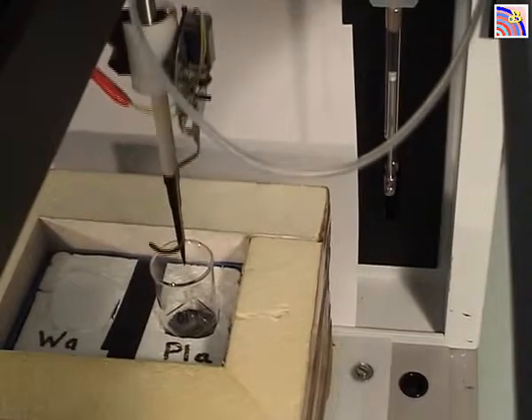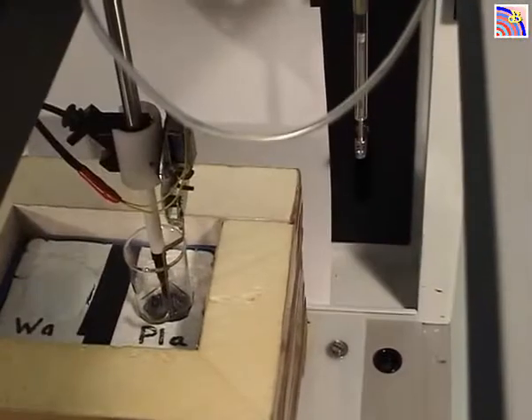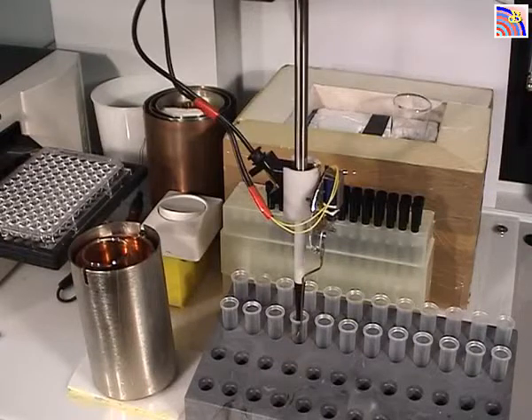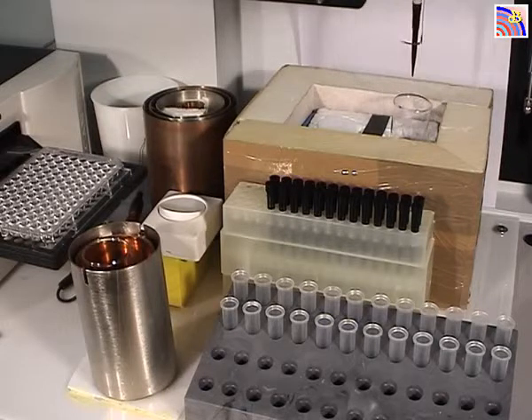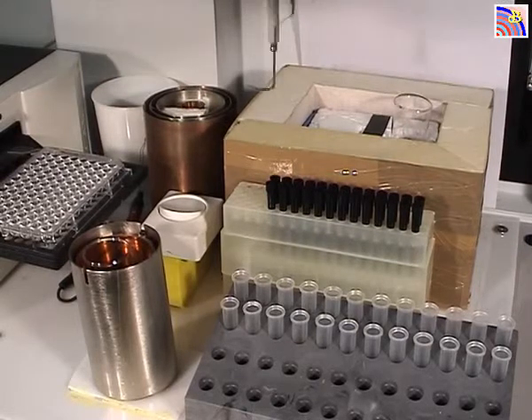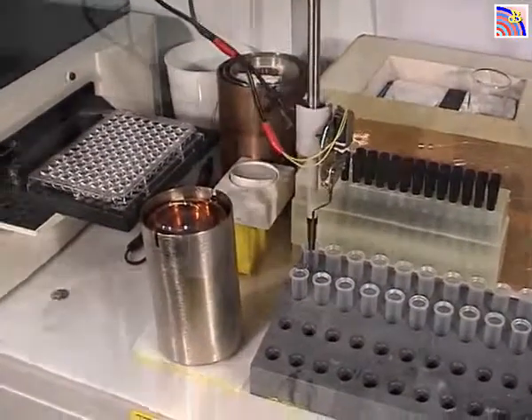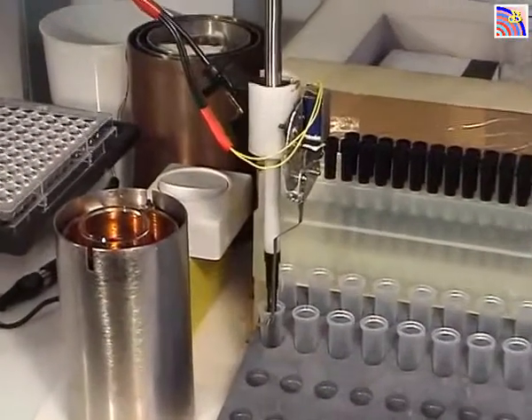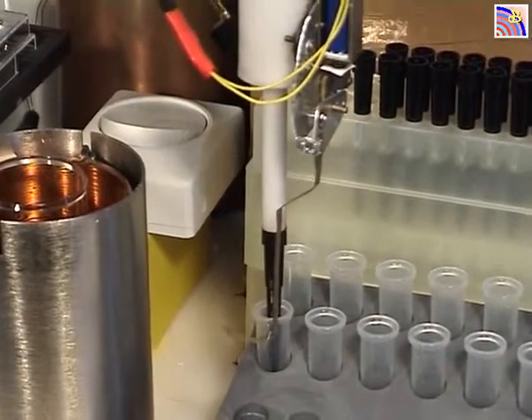You can see the syringe moving up and down, aspirating and spitting out the sample. Now the machine will mix the water — 200 microliters — with 400 microliters of plasma, so there will be a one-third dilution of the plasma, and mix it thoroughly.